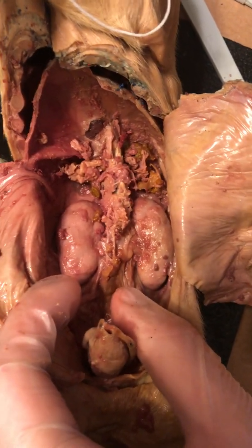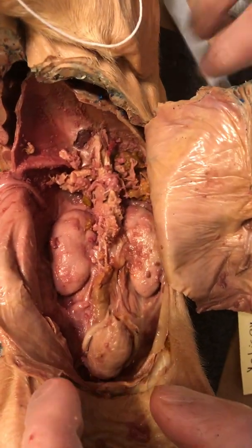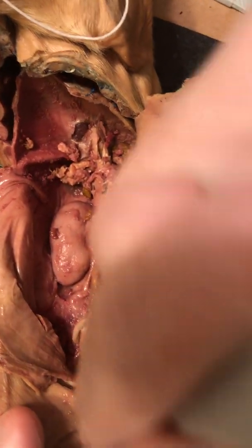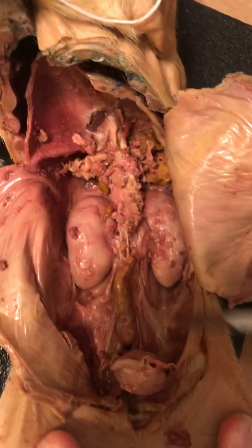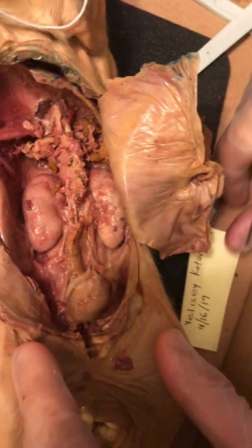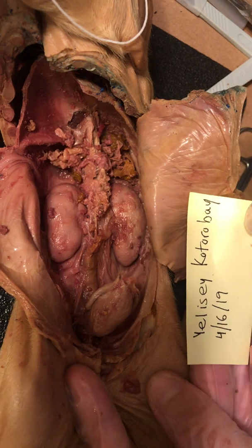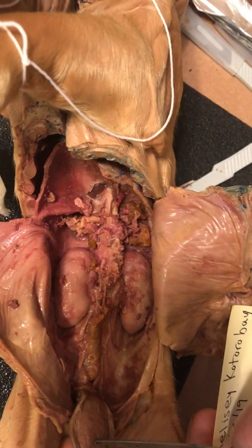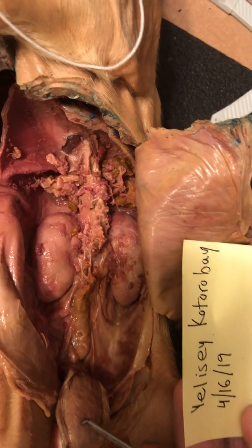Next, we're also going to take another picture, but this time with the urinary bladder. I can do that like so. The way they have it done is they actually have it extended forth like so. So we have the bladder. Let me see if I can just use this. Alright, I'm going to take another quick picture of what I need here.